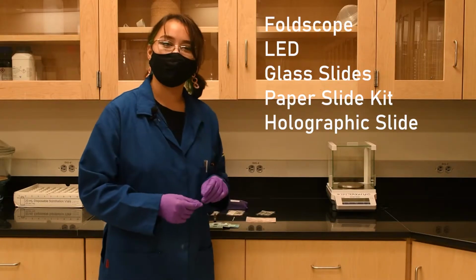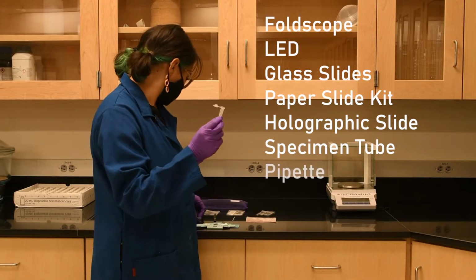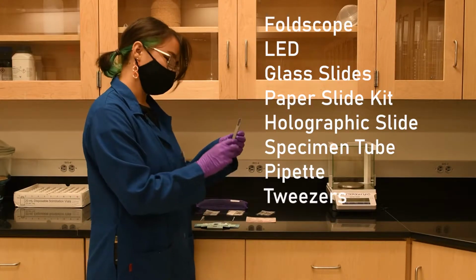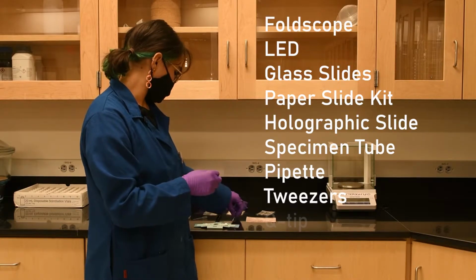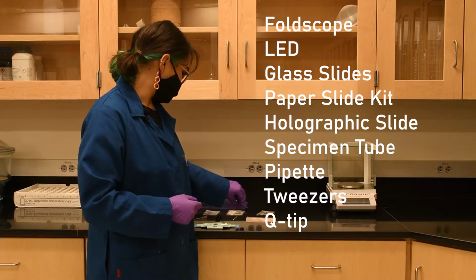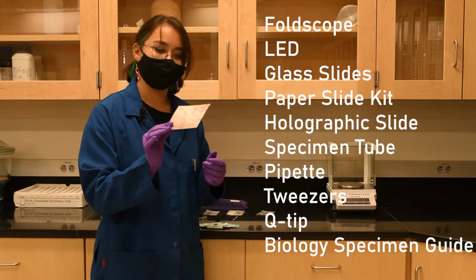To prepare your slides, we've included a set of tools to assist you. Here we have the Eppendorf tubes, pipettes, a set of tweezers to pick up and place your samples, and a small Q-tip included to also place your samples. Included is also this biology field guide with cartoon representations of some things that you can take a closer look at.